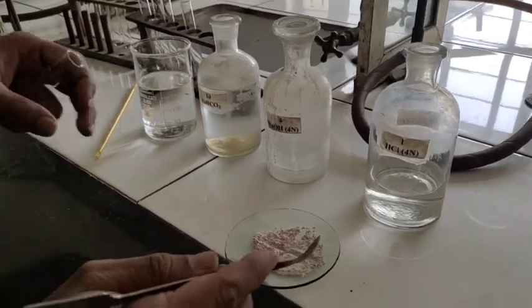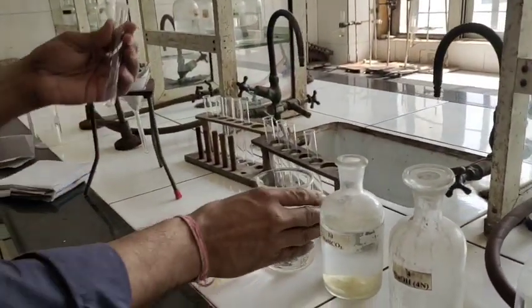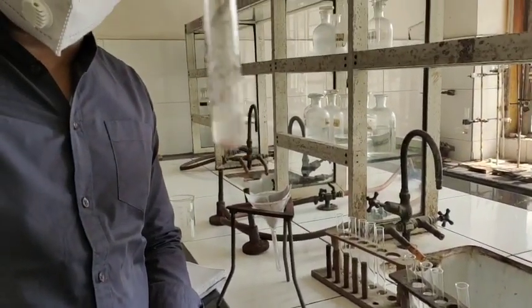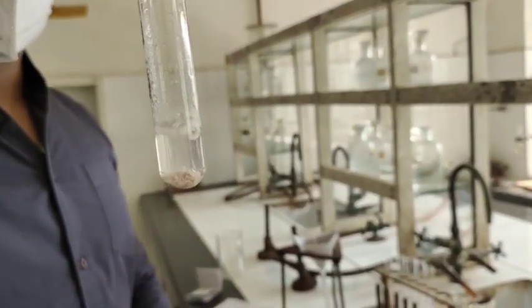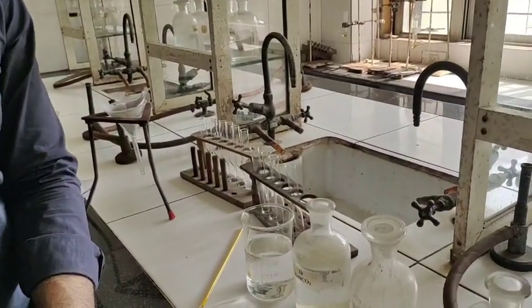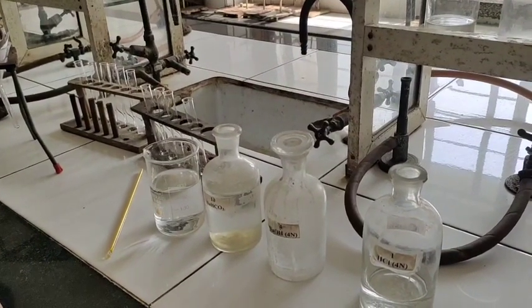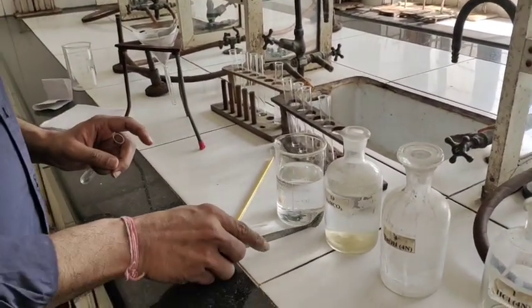So the first thing we do is take the organic binary mixture and add a small amount of water, and we see whether the quantity of the compound is decreasing or not. I don't see any decrease in quantity, so I can say that both organic compounds are water insoluble. Though there is one more test by which we can confirm whether the given molecule is water soluble or water insoluble — keep watching the video.